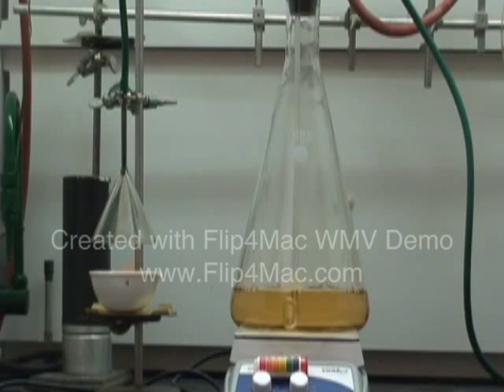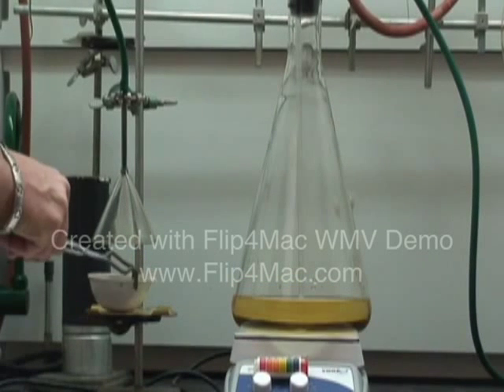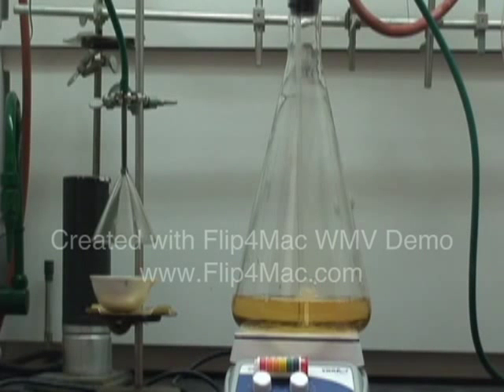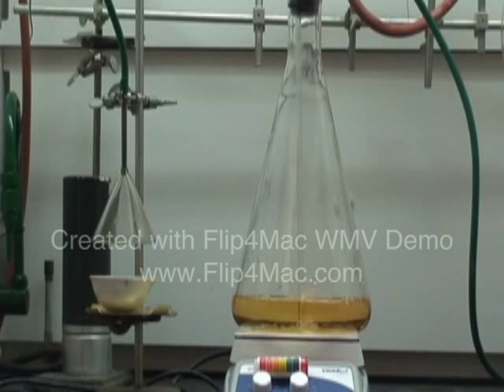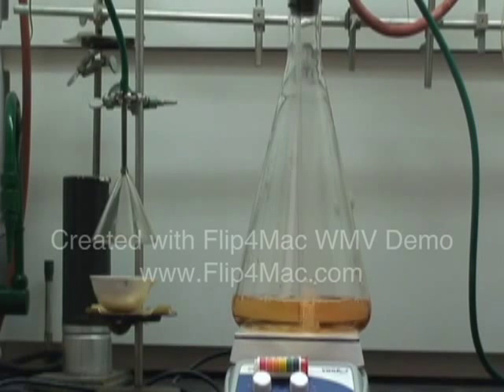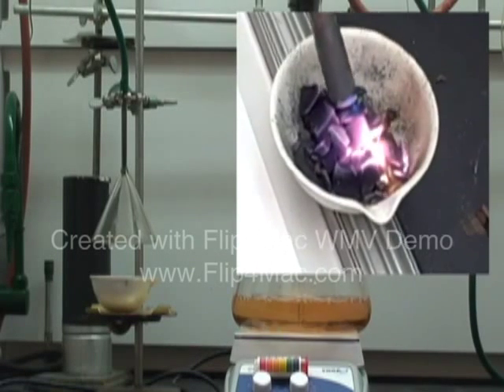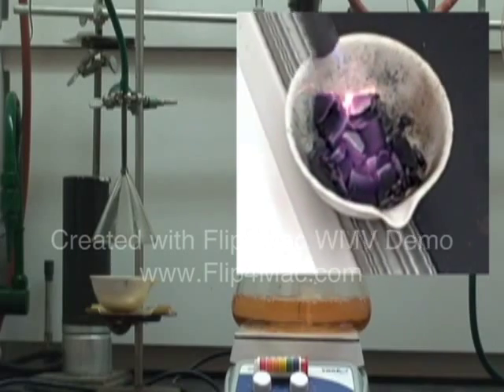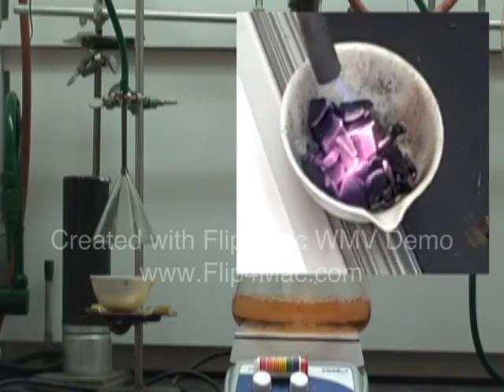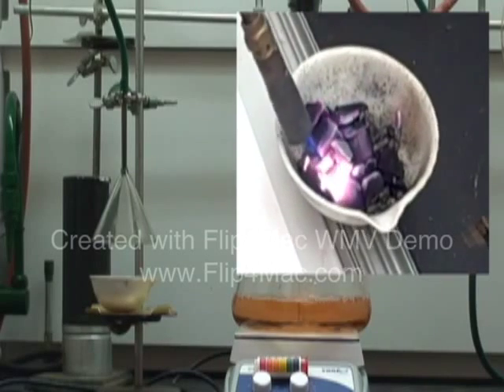And this is our sample of dirty coal, and what effects dirty coal has on the pH of water. So we're igniting our coal sample now. It's harder to observe directly because the coal doesn't put off a flame.